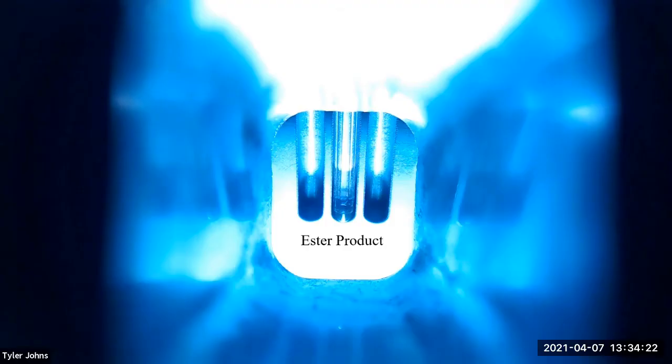We will now perform a micro-scale boiling point determination of the ester product.